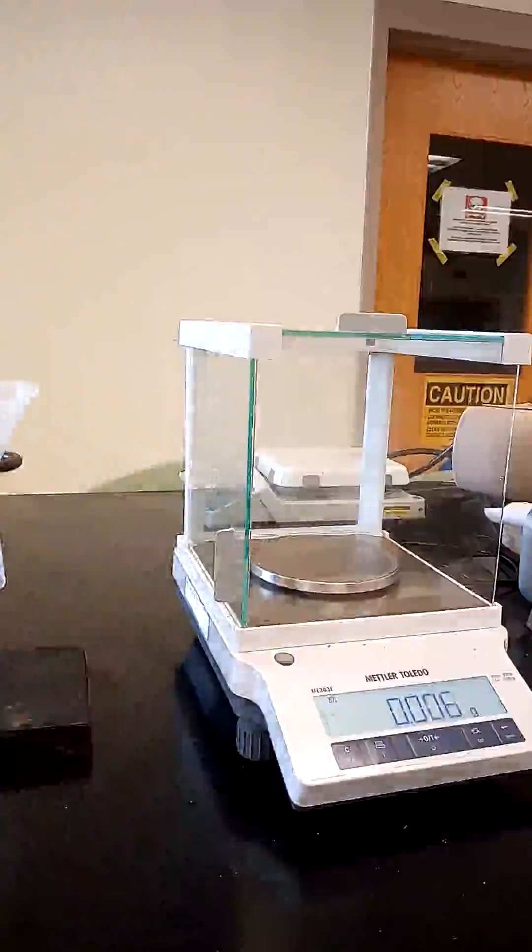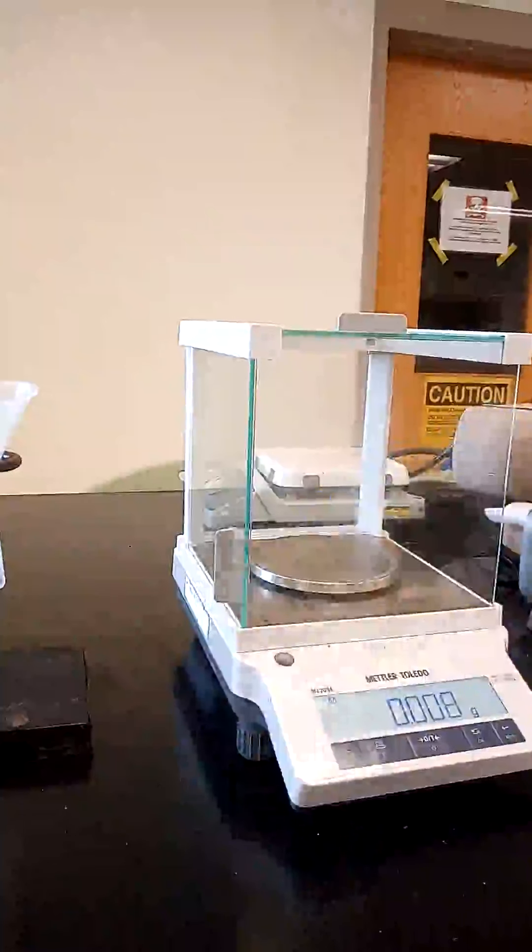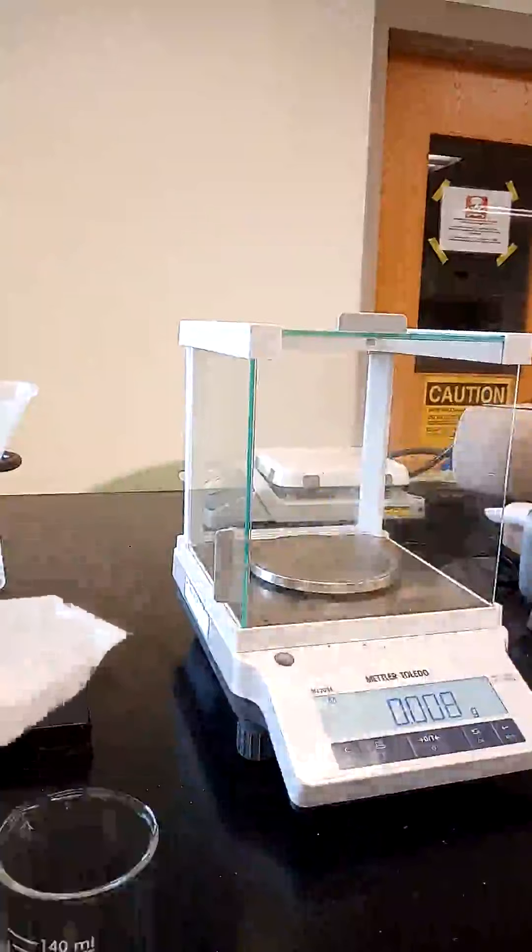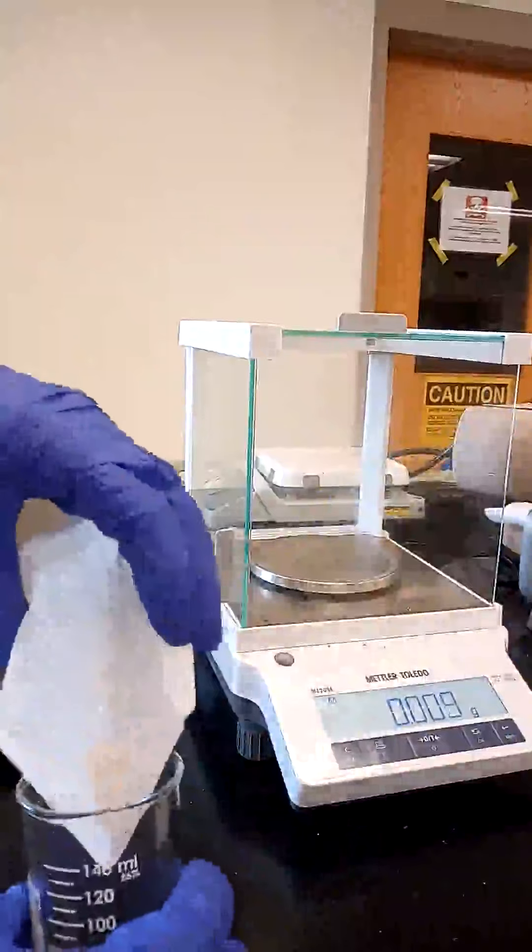We now take our clean, dry 150ml Beaker 1 and transfer the sample to the beaker.